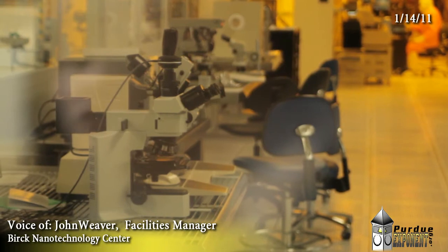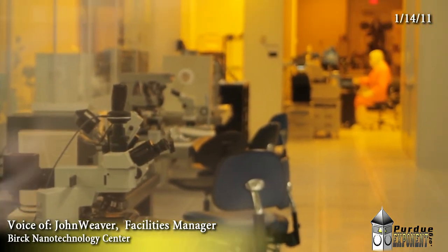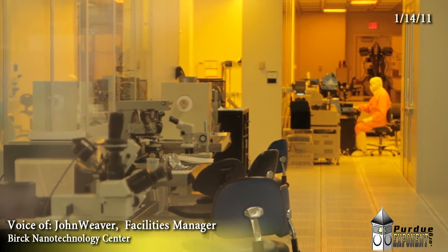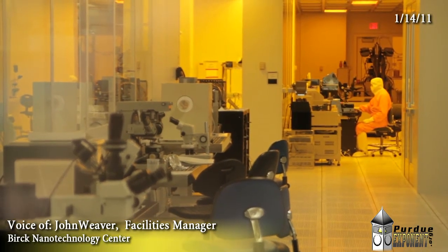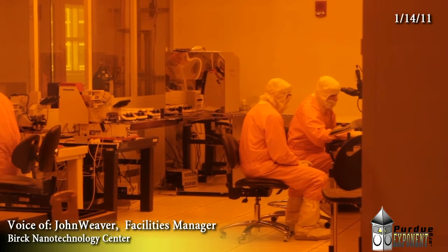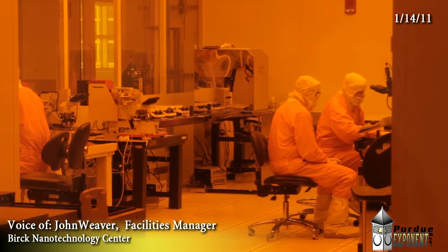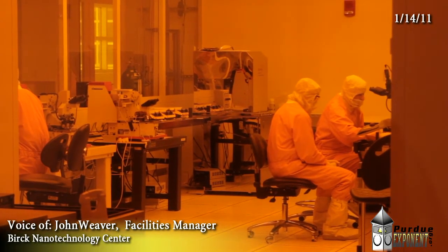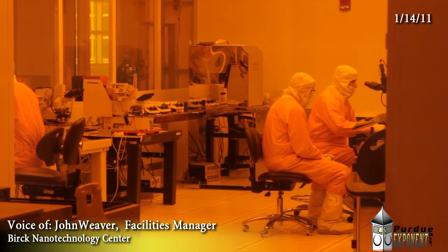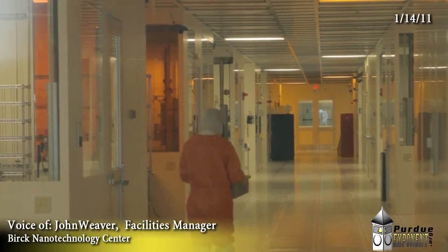A clean room is an area where particle concentration, as well as many other parameters, is carefully controlled. We're an ISO 3 facility, which is pretty well on the lower edge of anything in existence. We are the cleanest university clean room in the country.